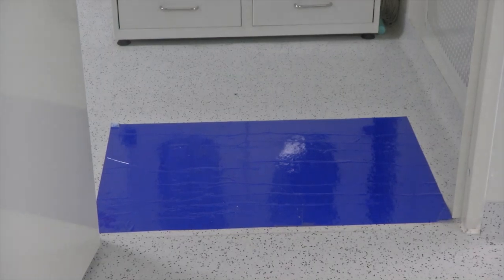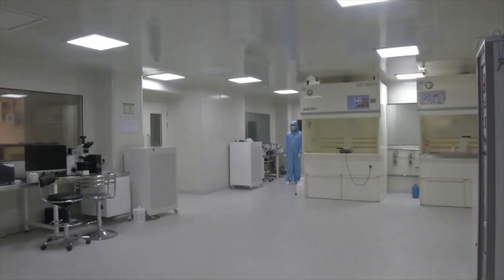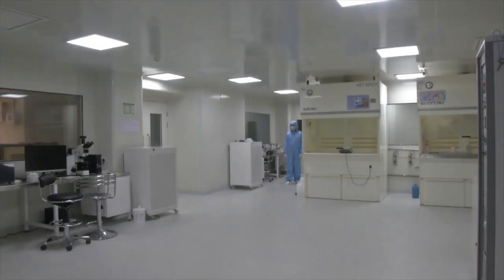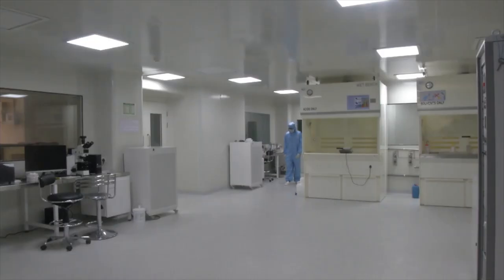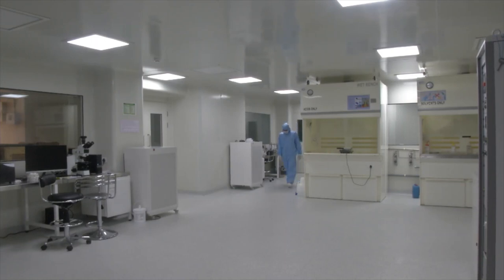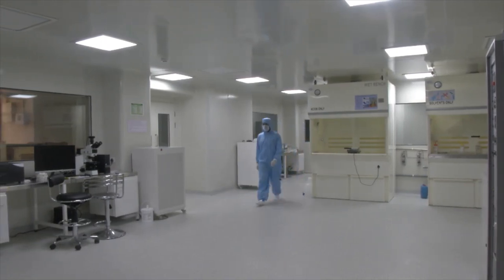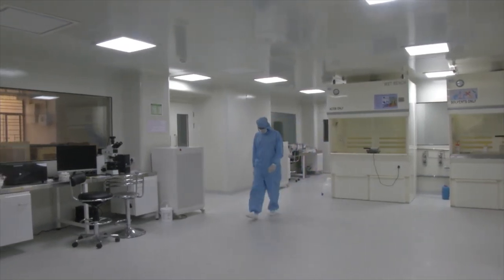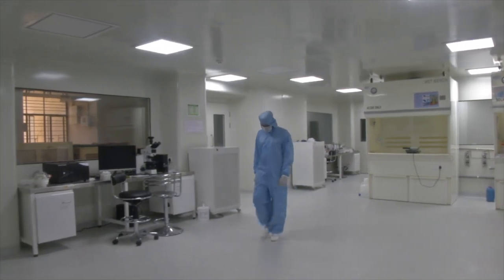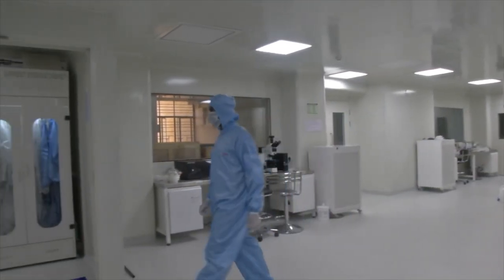This is how we enter a clean room. Now we will see how to remove the clean room gown, or how to exit a clean room. This process is also called doffing of the gown.